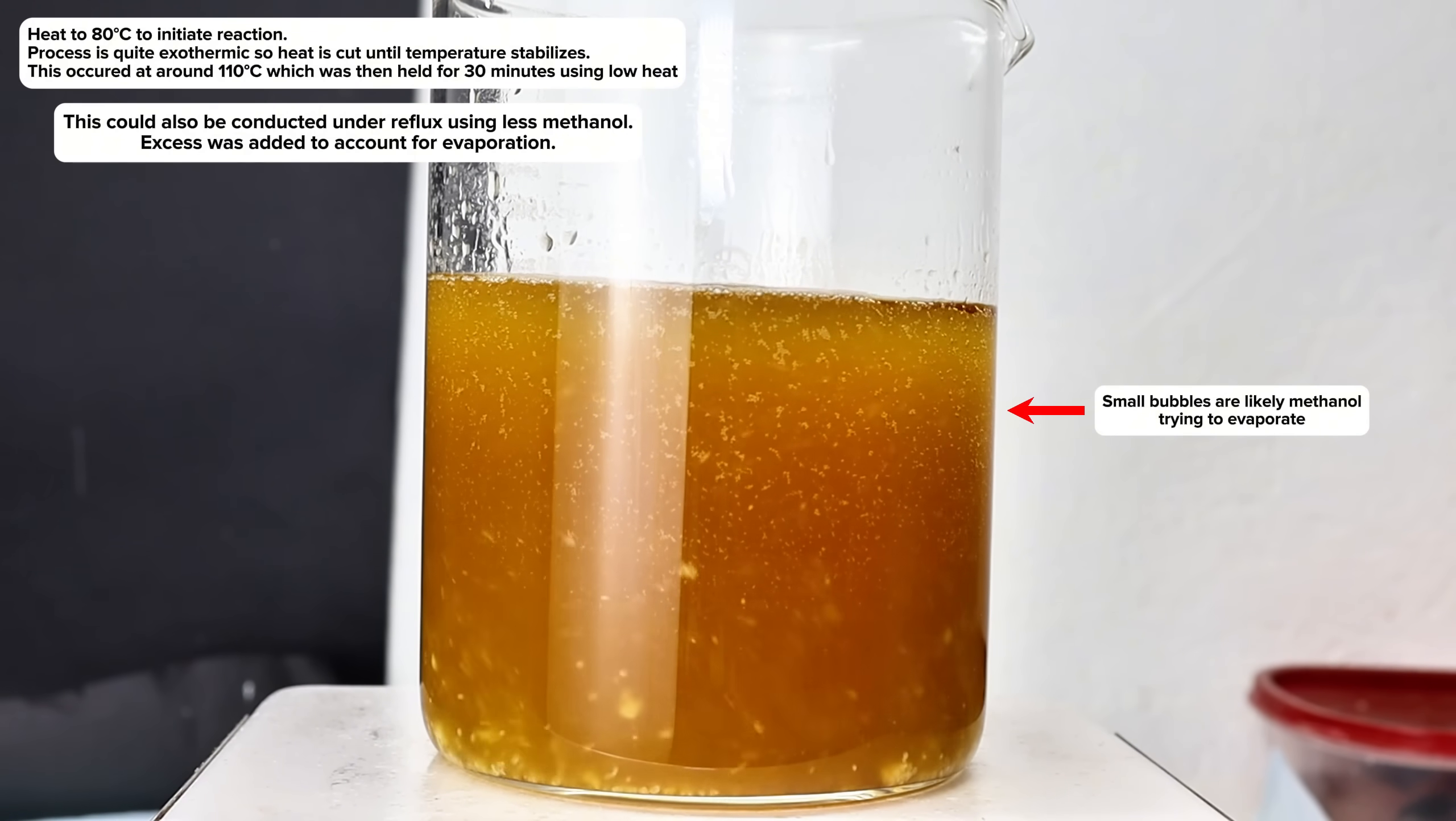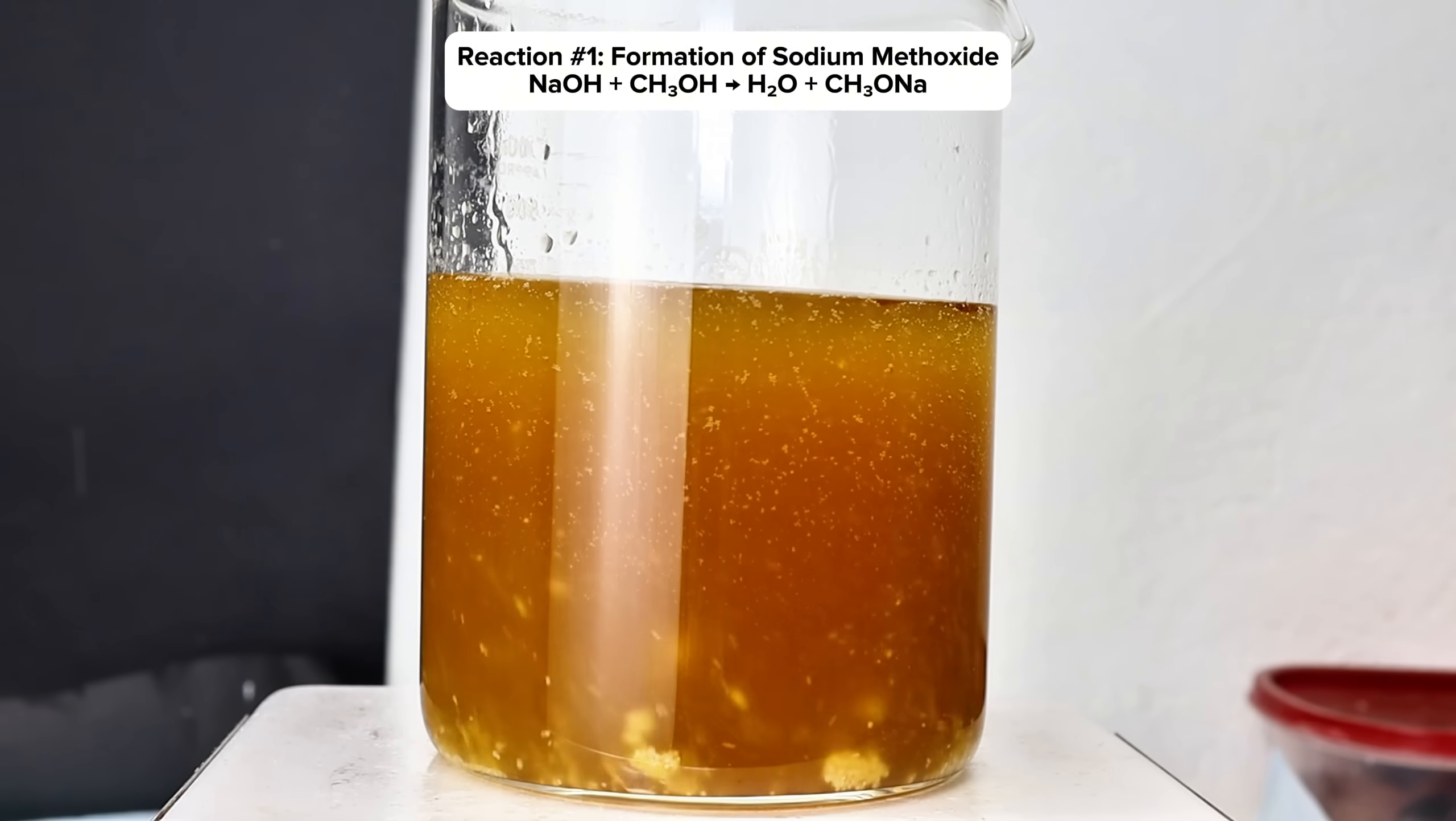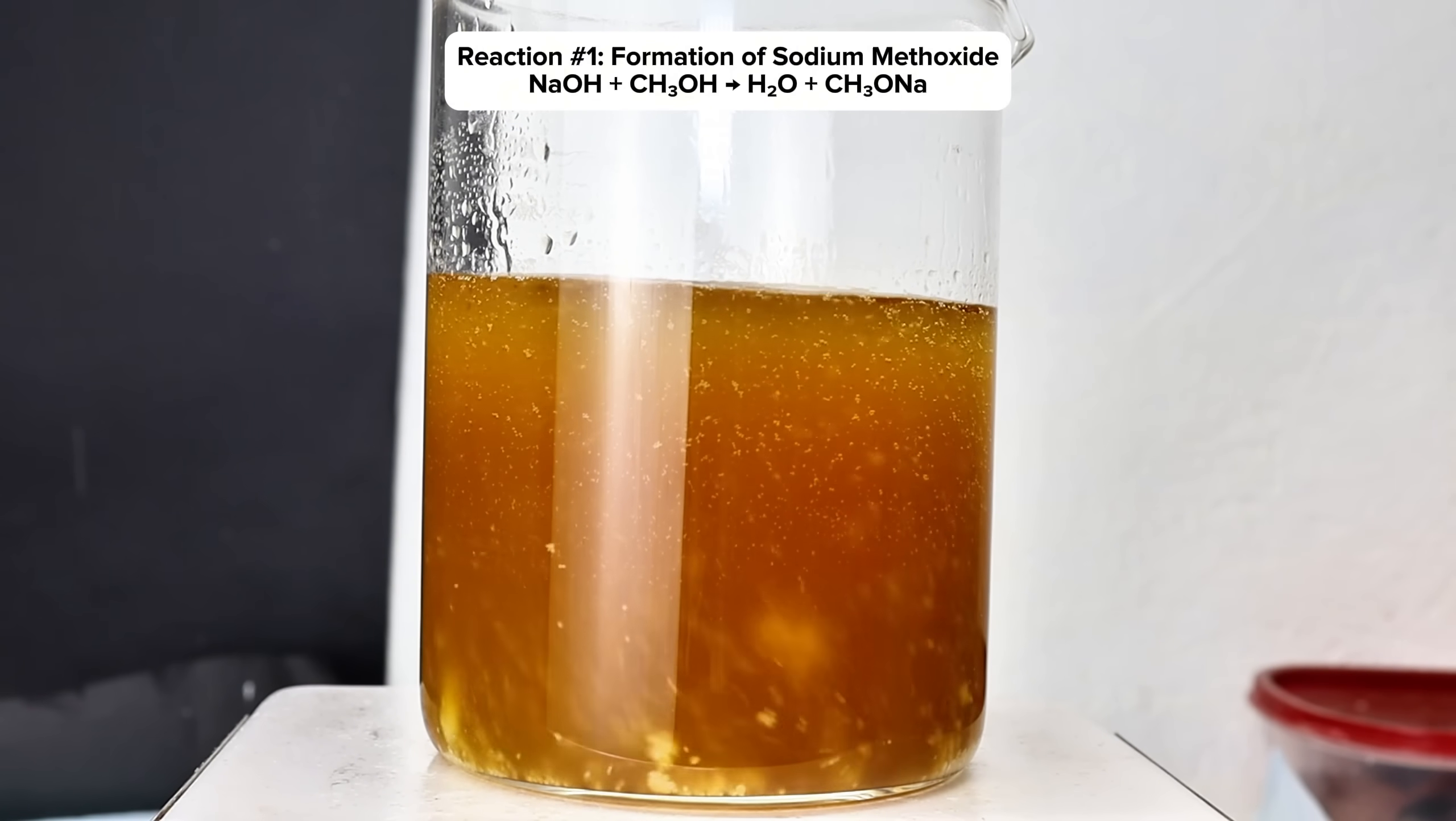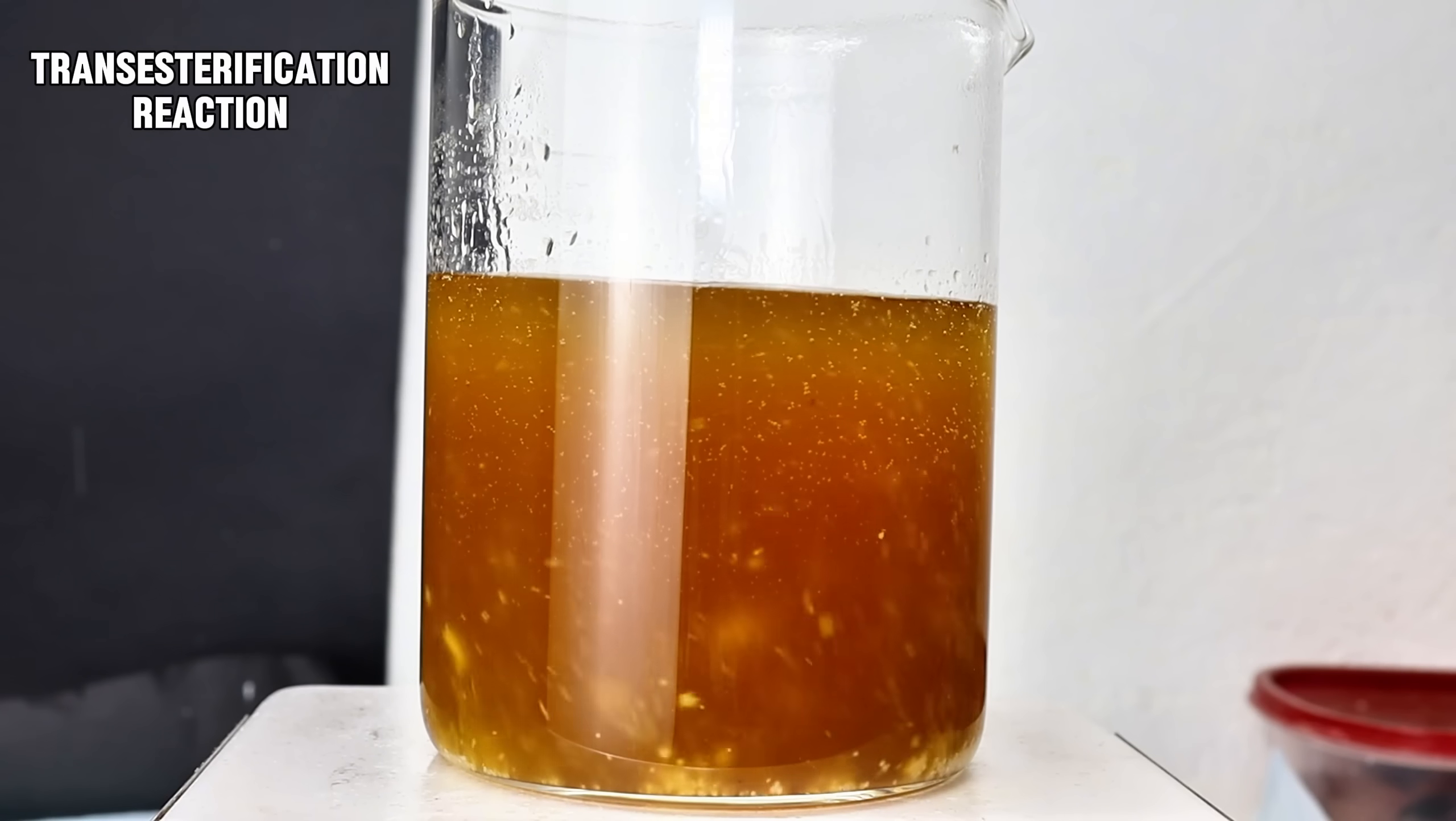Now what's happening here is a two-step reaction that begins with a simple reaction between methanol and sodium hydroxide forming sodium methoxide and water. The sodium methoxide then immediately begins to react with the oil in a type of reaction called a transesterification, which is very similar to the process used to make soap.